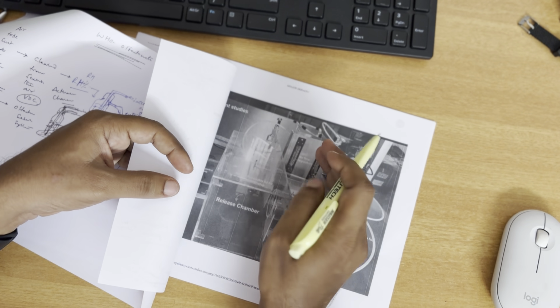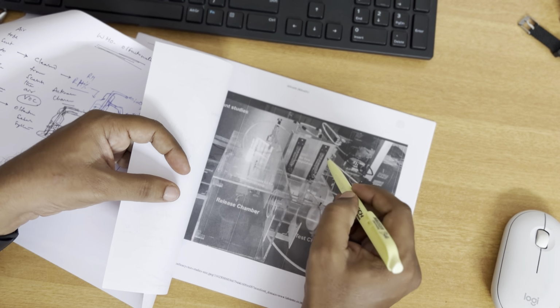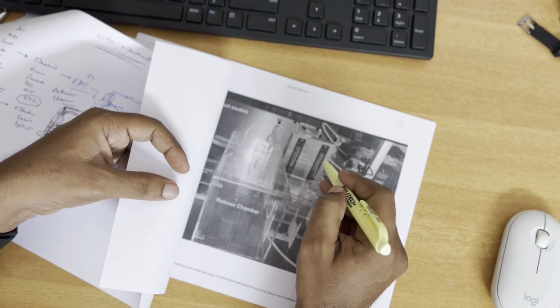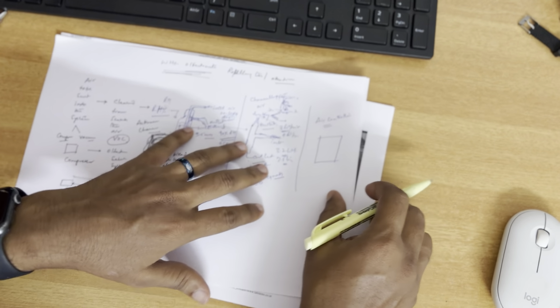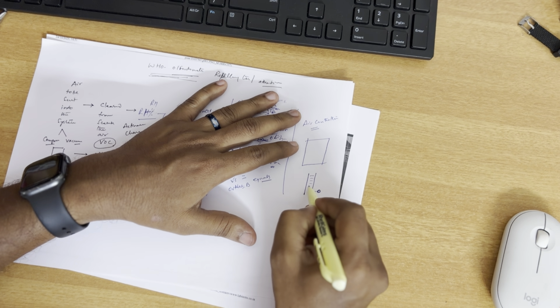We're going to discuss where we need to give the input, and where you need to give the output, and how to use the knob to turn, increase or decrease the total amount of air that is going out from port A as well as port B. So now if you see, this is the side view of the air controller unit. You see the knob here, you see the scaling here.